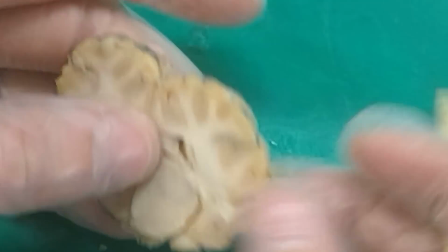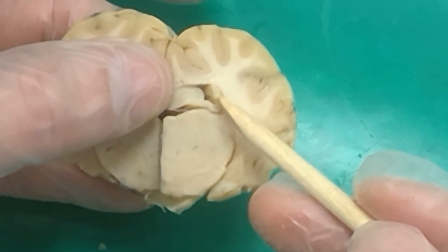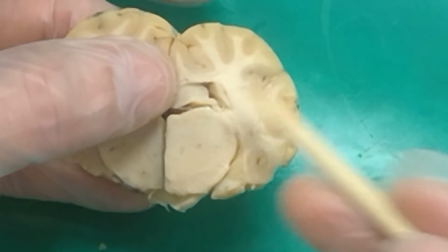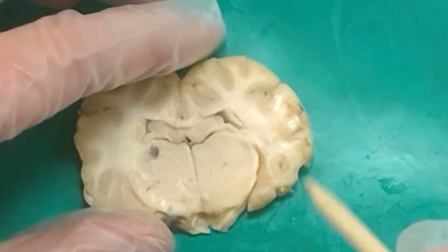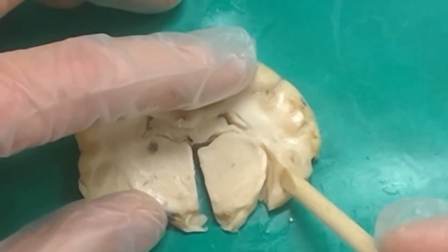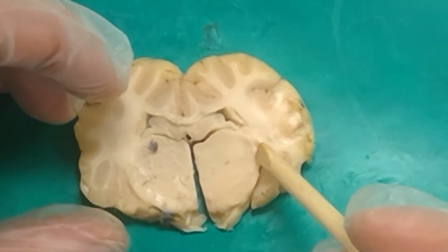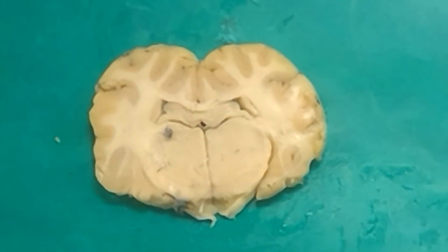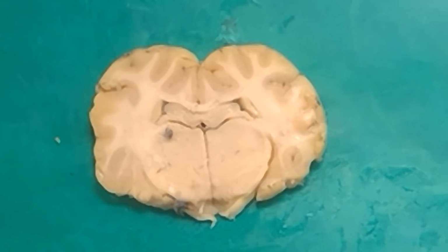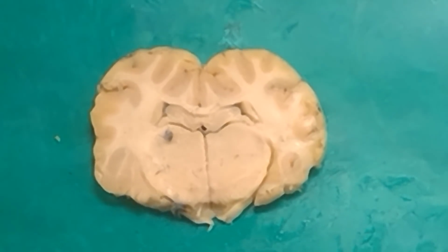If you can see these fibers right here that are connecting between that top and bottom part of the hippocampus, what do we call those fibers? Fimbria, right. So that's like the webbing of my hand, connecting the top and bottom of the hippocampus. These fibers that are running along the side of the thalamus right here, optic tract, right. You could also call them optic fibers. There's just two names for the same thing. You can't call them the optic nerve, though, because the nerve is before we get to the chiasm.